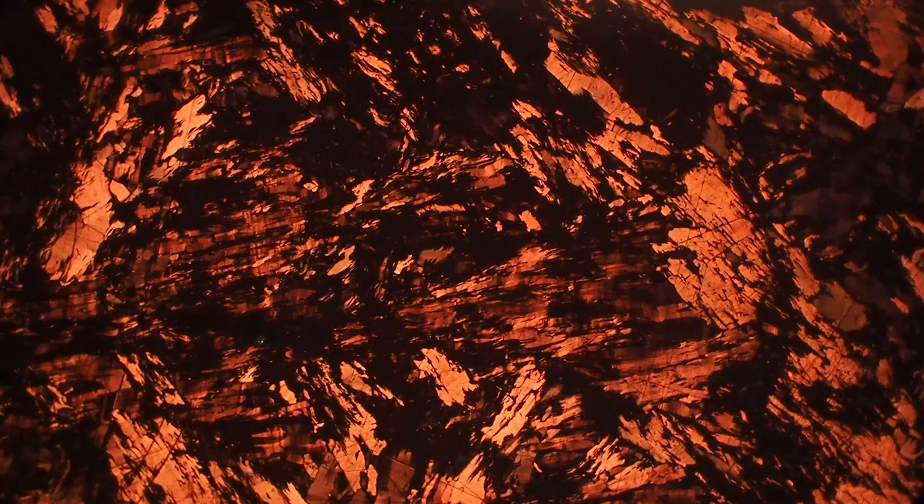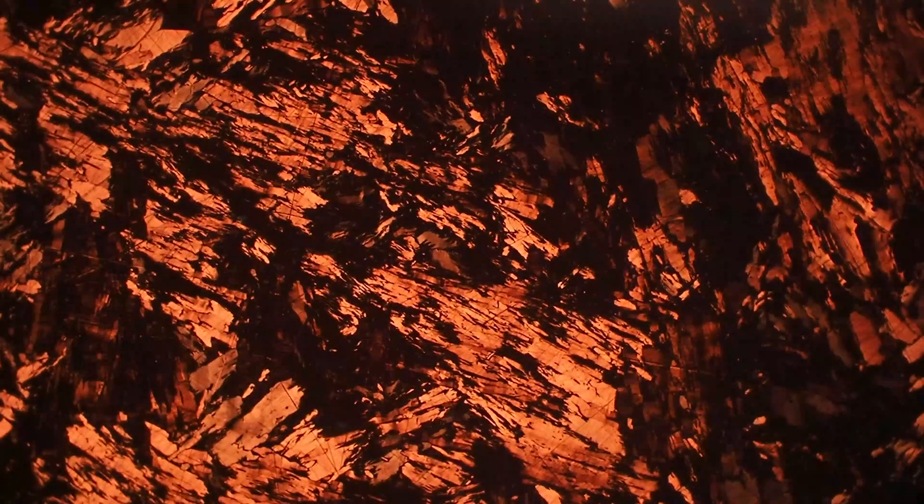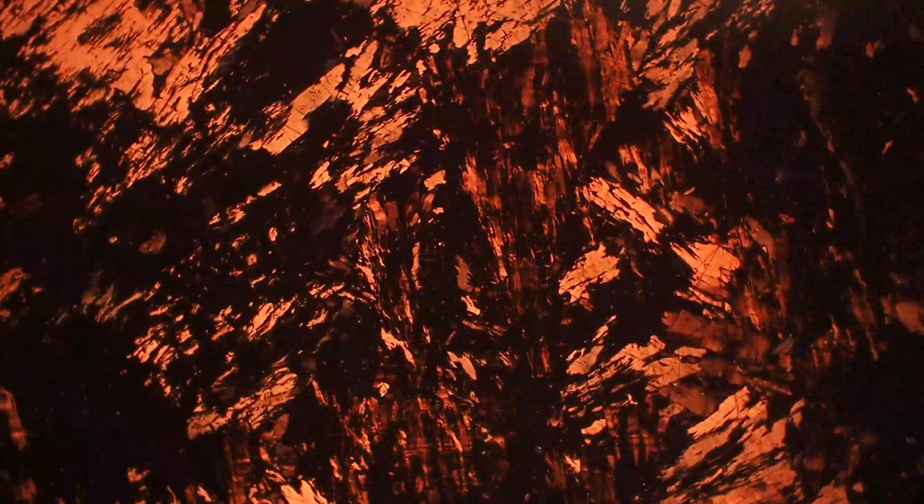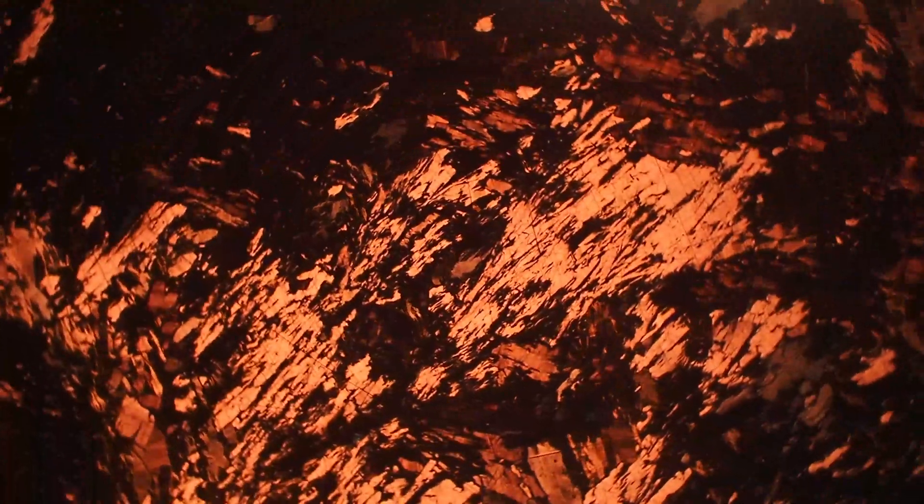Now if we cross the polars again, we have that same bright red-orange color, and as we rotate the stage it goes to kind of a brownish or dark color. This is again due to the very strong anisotropy that covellite has.